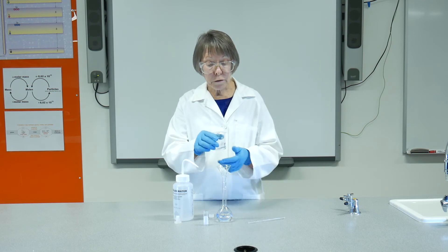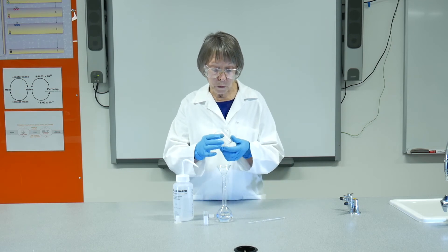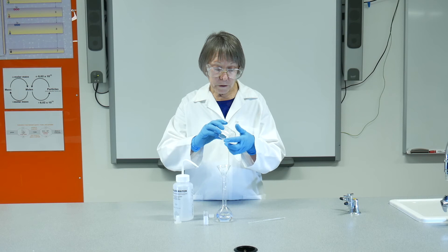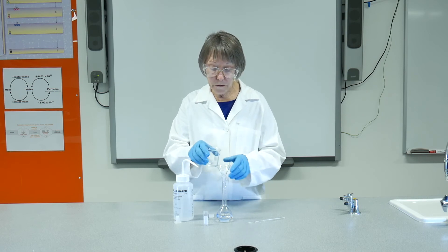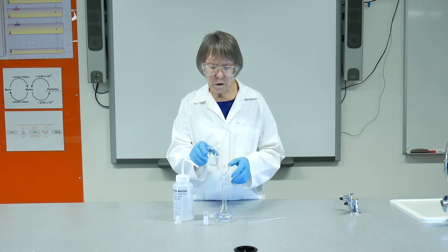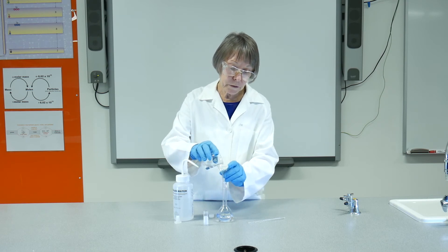Much better to use a lot of small rinses than to use one big rinse, because you're practicing a serial dilution when you do that, which is far more effective with small volumes than it is to simply use one large volume.